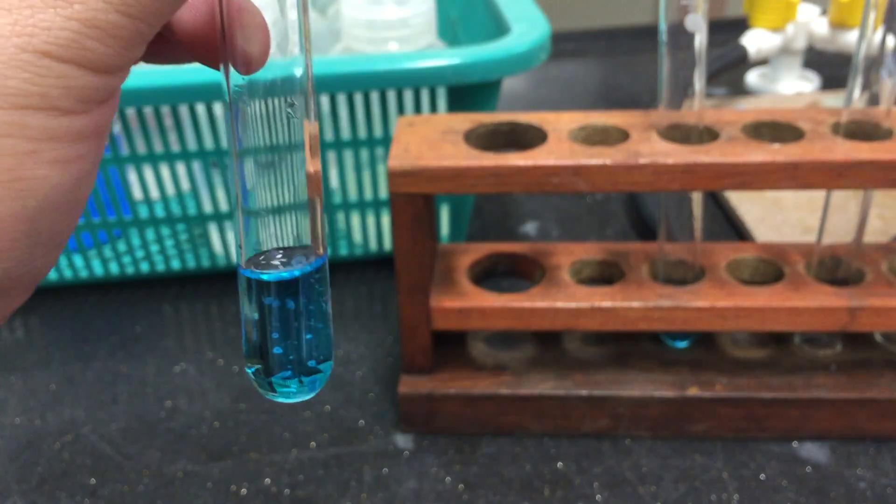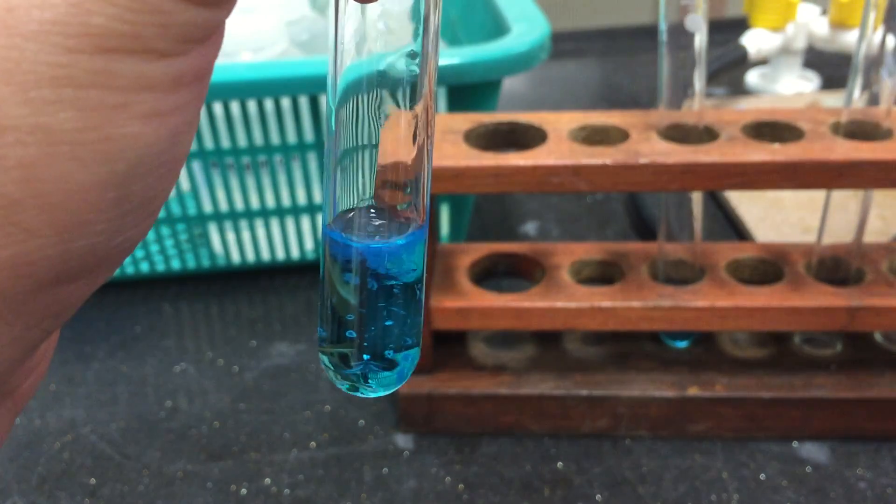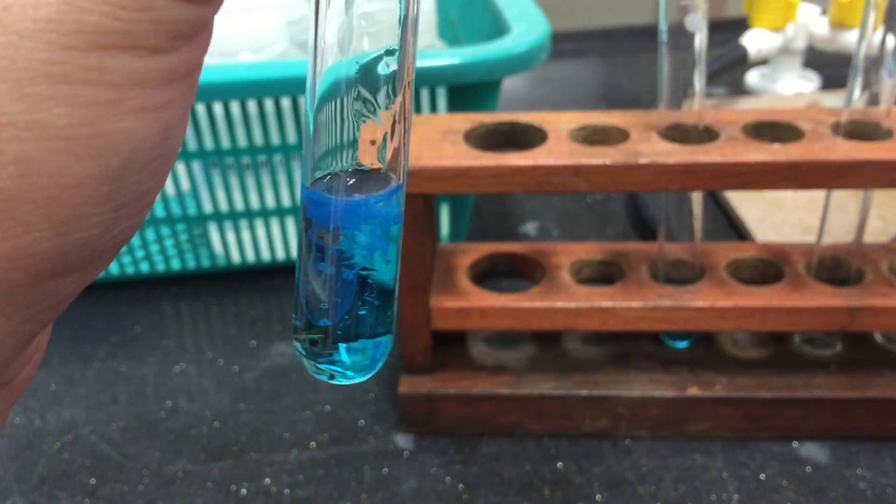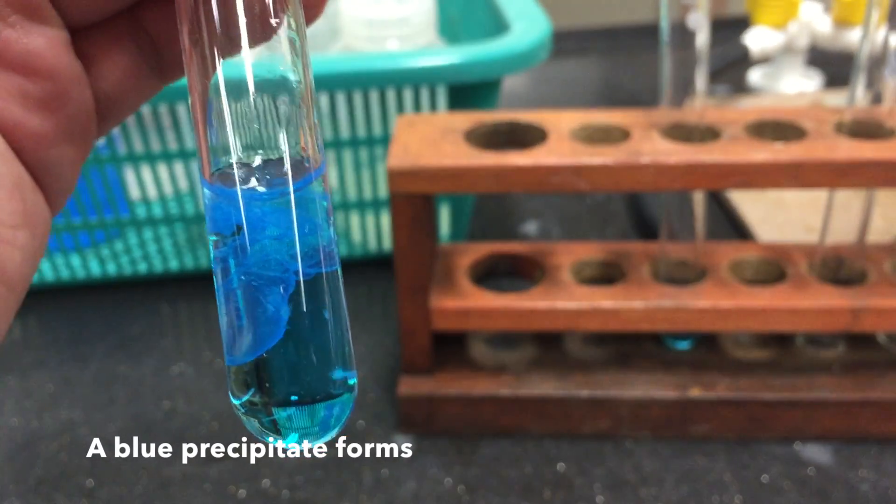To a small sample of your solution, add a few drops of sodium hydroxide. You will notice that the blue precipitate forms.